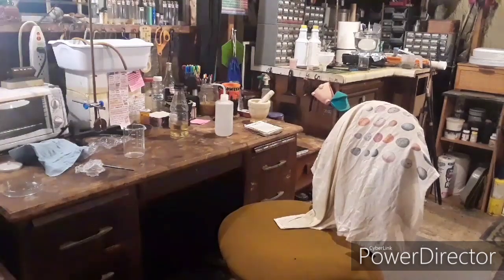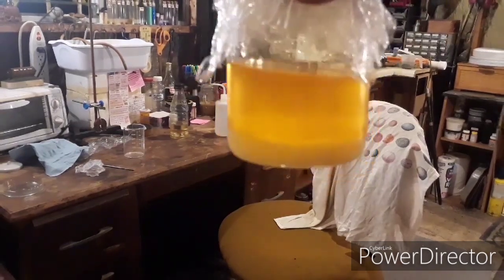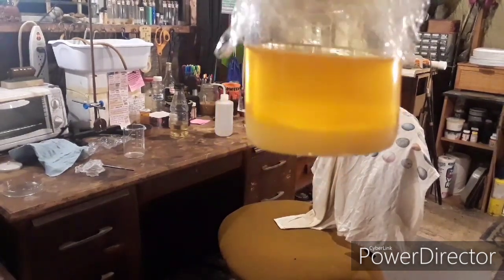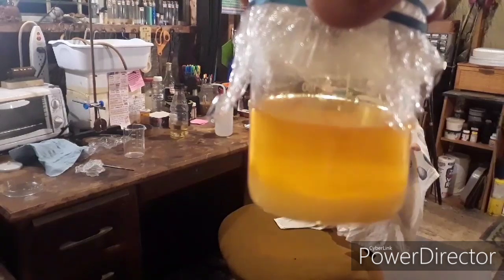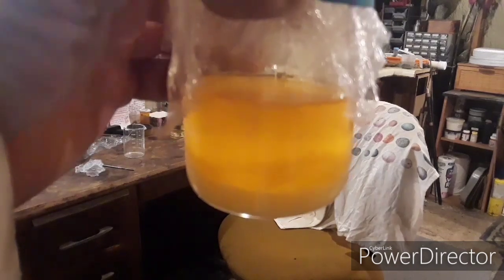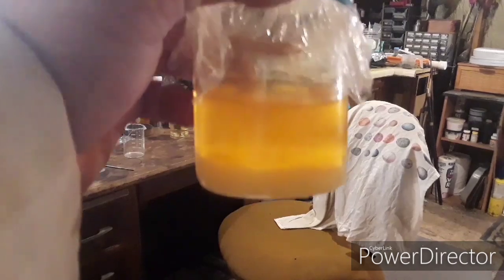Our nitric acid has been cooling in the fridge for about an hour. You can see on the bottom there is our nice precipitate — that is our target product, the calcium nitrate. I'm going to filter this off. I was thinking about doing a vacuum filtration for expedience, and then we'll take a rough weight to figure out our actual percent yield based on our starting material.